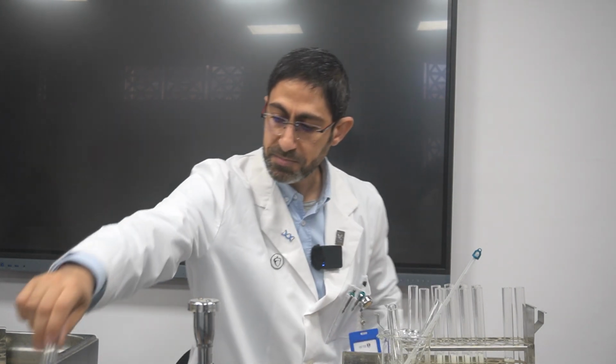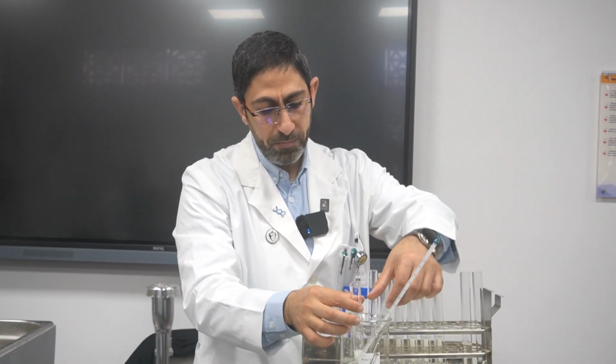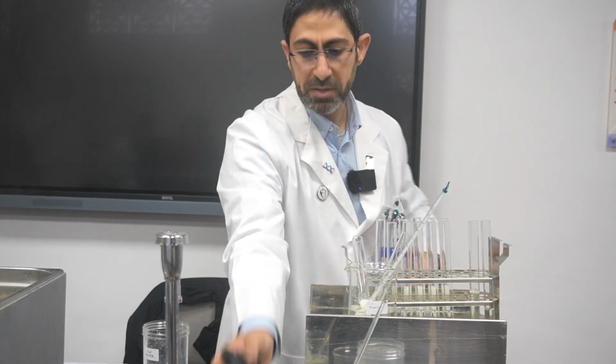Yes. So now I'm going to mix both. I will measure 10 minutes.